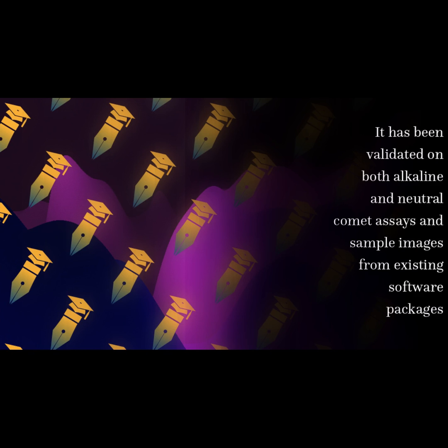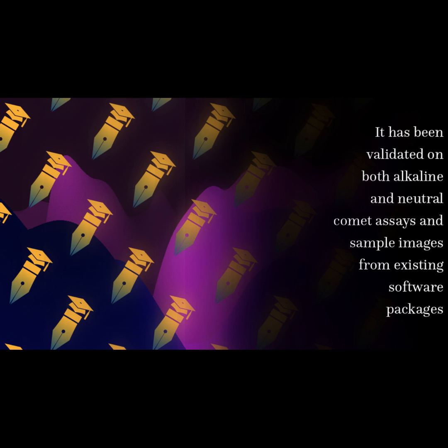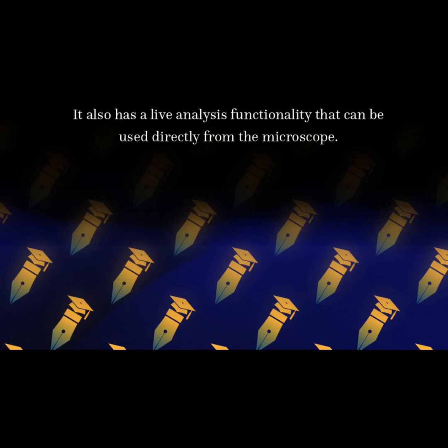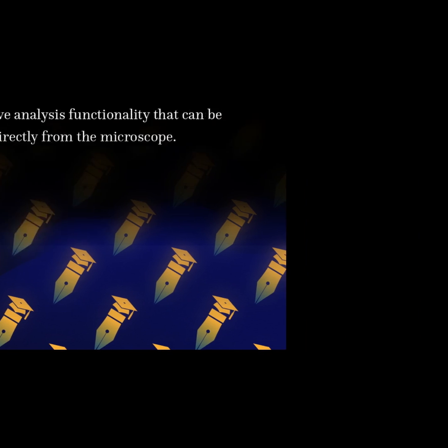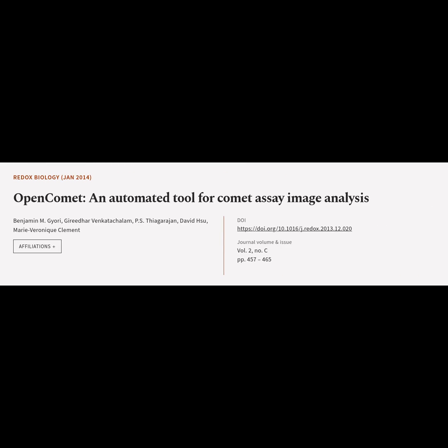It has been validated on both alkaline and neutral comet assays and sample images from existing software packages, and includes live analysis functionality that can be used directly from the microscope.